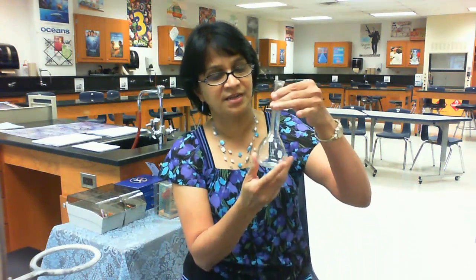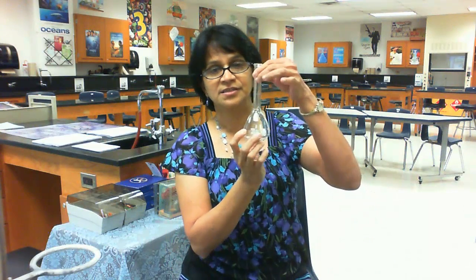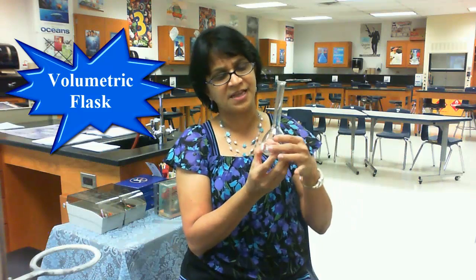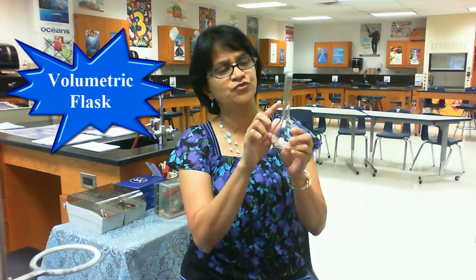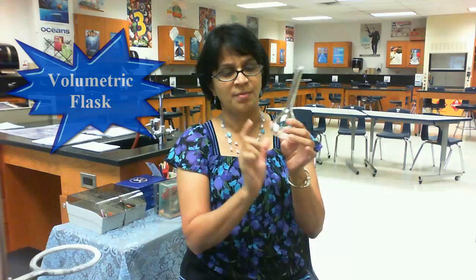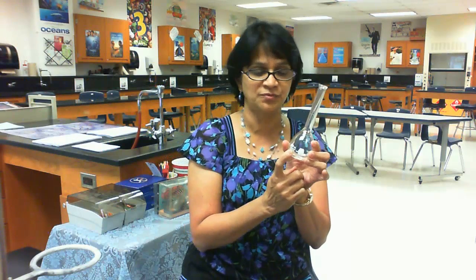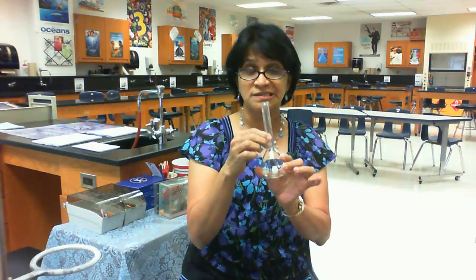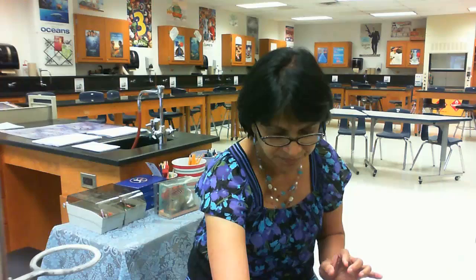The next one is the volumetric flask. It usually has only one measurement mark and it tells you the capacity of the flask. This is very accurate and can be considered a precise piece of equipment.